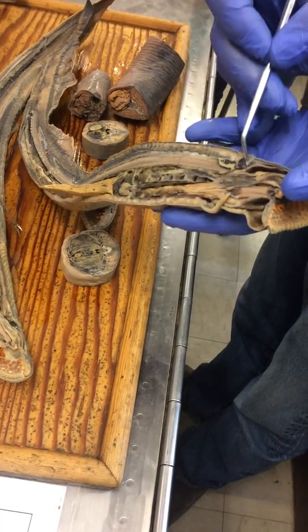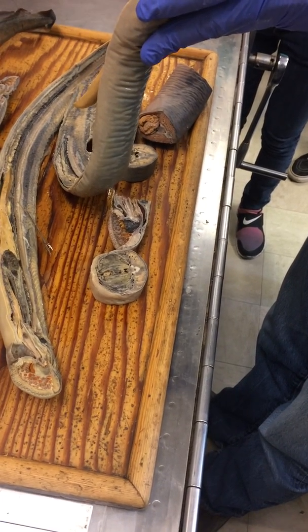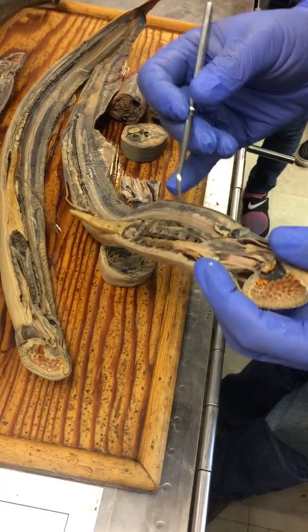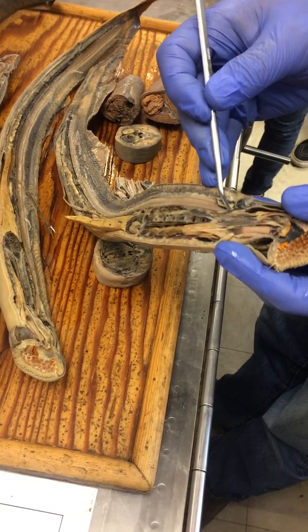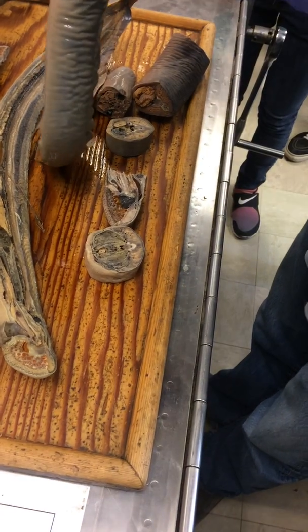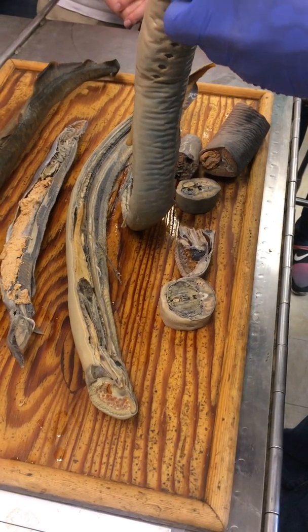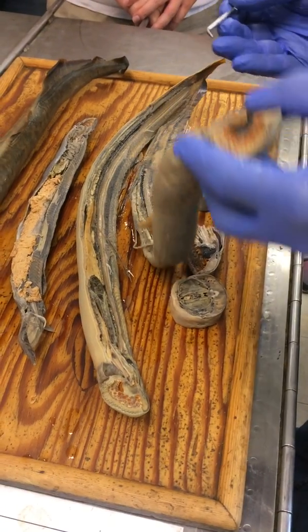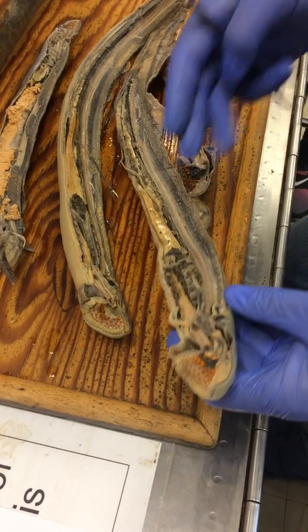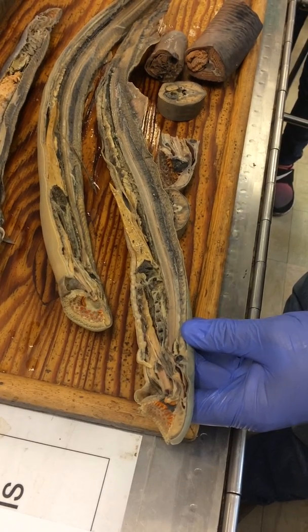There's a dark spot that you can see here just in front of the brain — cranial to the brain — and that's the olfactory sac. That's where the nostril leads to, down to the olfactory sac. These guys are kind of interesting because there's a pouch that continues from the olfactory sac down in front of the tip of the notochord. Here's the tip of the notochord; there's the olfactory sac, and continuing down is this pouch called the hypophysial pouch. Together this whole thing is the nasal-hypophysial pouch or apparatus, and basically what it does is allow pressure changes happening in the pharynx when they're pumping water in and out across the gills to move water in and out of the nose as well for sniffing.